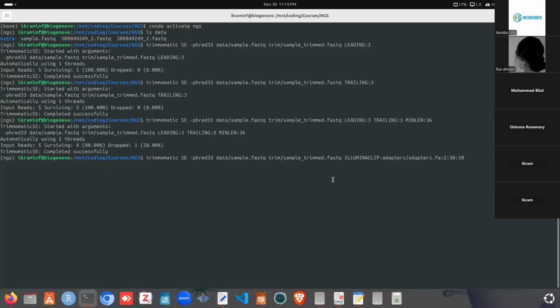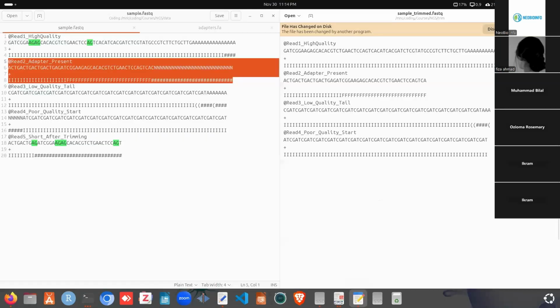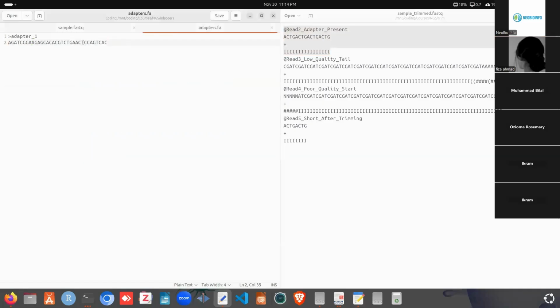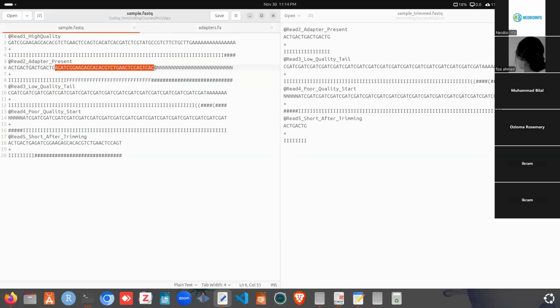If we run this command again and reload the output in here, we can see read 2 in here. So how it actually works: if we take this adapter and search in here also, we can see it matches at this position. So when we find an adapter and where it matches, from the start position to the end, all the bases will be trimmed. When you find any adapter content, then from the first base to the end, all the bases will be removed. So for that reason, we see this for this one actually. And for read 3 and read 4, we don't have any adapter matches. But read 5 actually finds some match with this region. So it removed that, and after removing, we got this sequence.